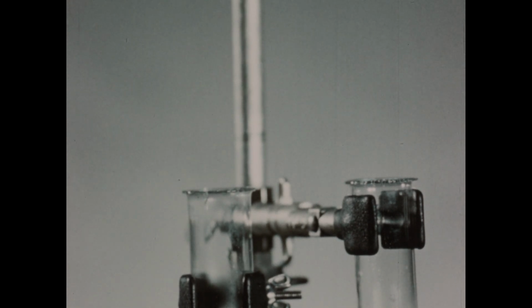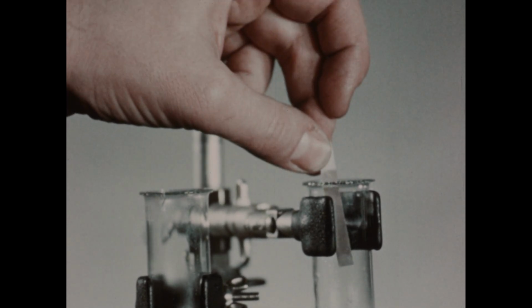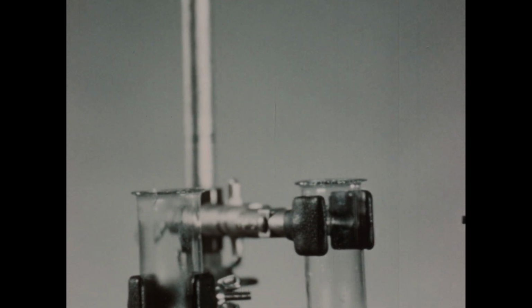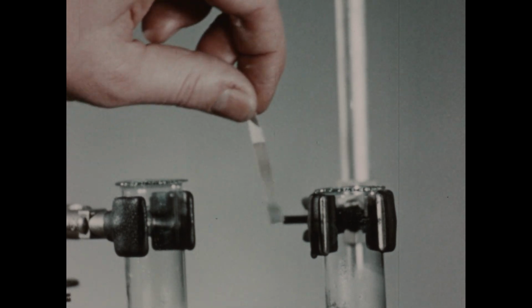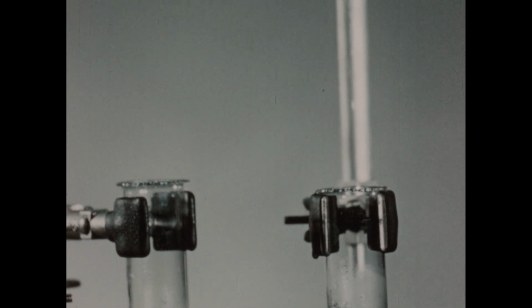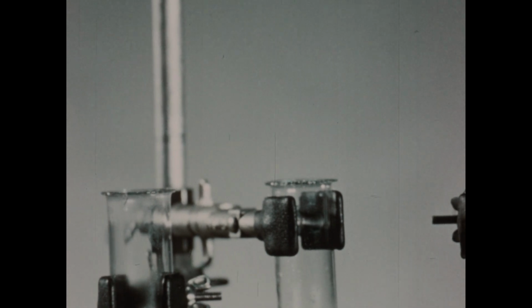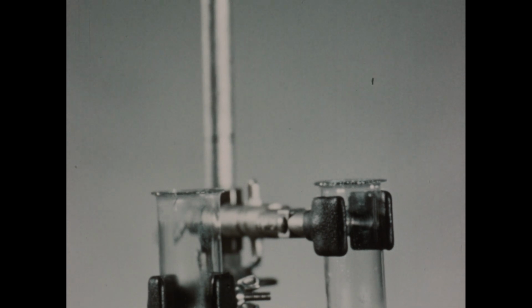Next, we'll test the tube containing the calcium chloride, manganese dioxide, and sulfuric acid. A positive test is obtained here also. Finally, we'll test the tube containing a mixture of potassium chloride, manganese dioxide, and sulfuric acid. And a positive test is obtained here. So in all 3 cases, when we've mixed a chloride salt with manganese dioxide and sulfuric acid, chlorine has been liberated by the reaction. And this method of producing chlorine is frequently used in the laboratory.